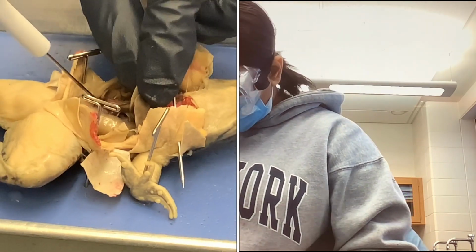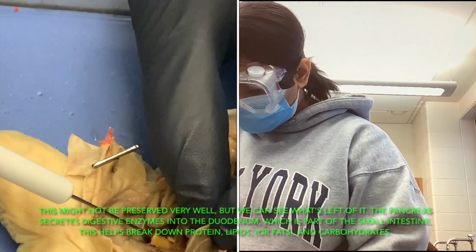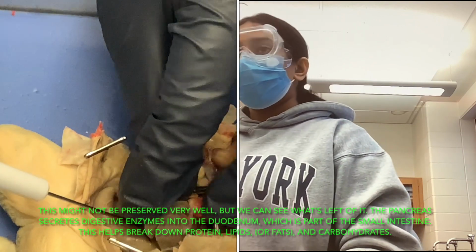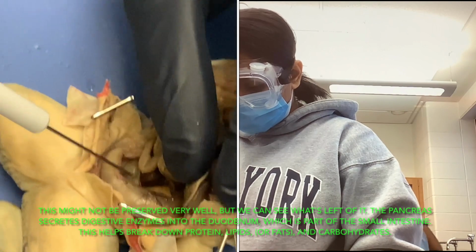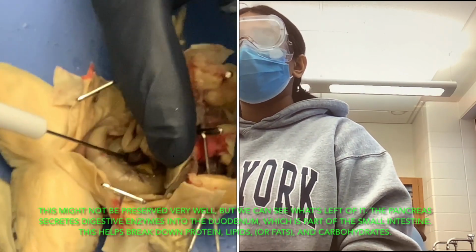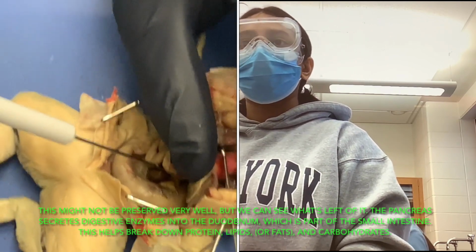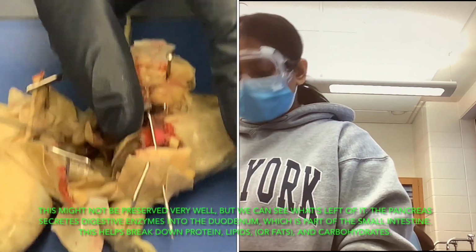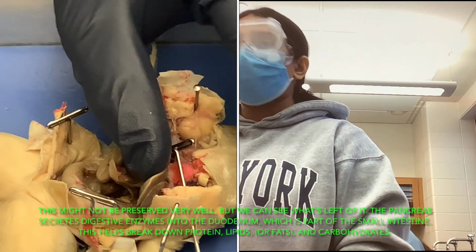Inside here, posterior, there is this small yellow portion. It is actually the pancreas, and it might not be preserved very well if there isn't a lot left. The pancreas secretes digestive enzymes into the duodenum, which is part of the small intestine, and it helps digest proteins, lipids, and carbohydrates, and by lipids I mean fats.